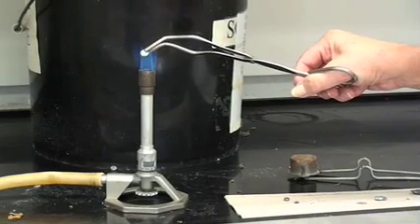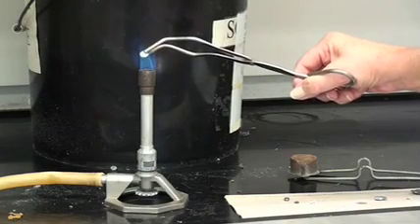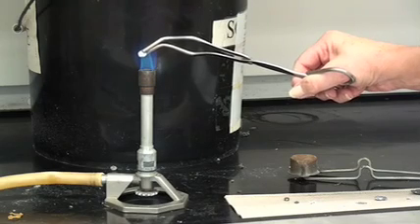I'm going to try to remind you that probably by this time with the calcium we were already seeing flickers of it burning. The flame had started to turn red.